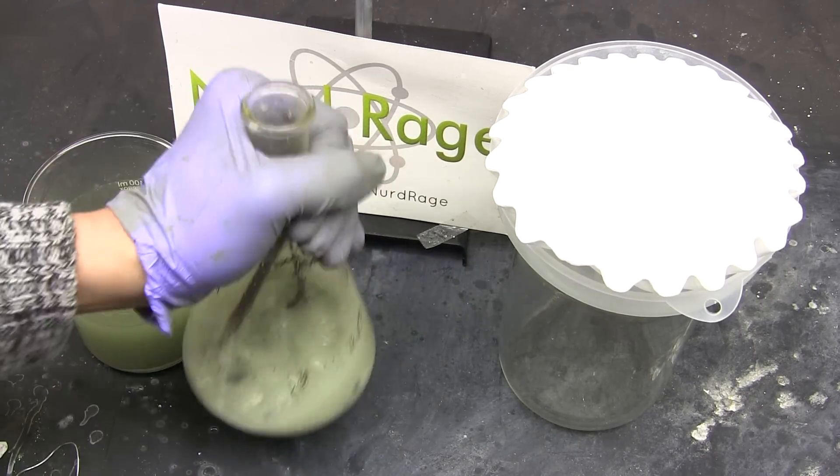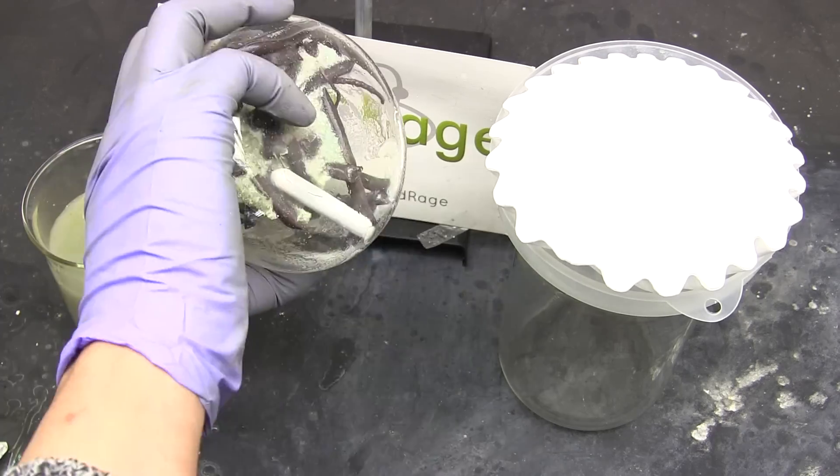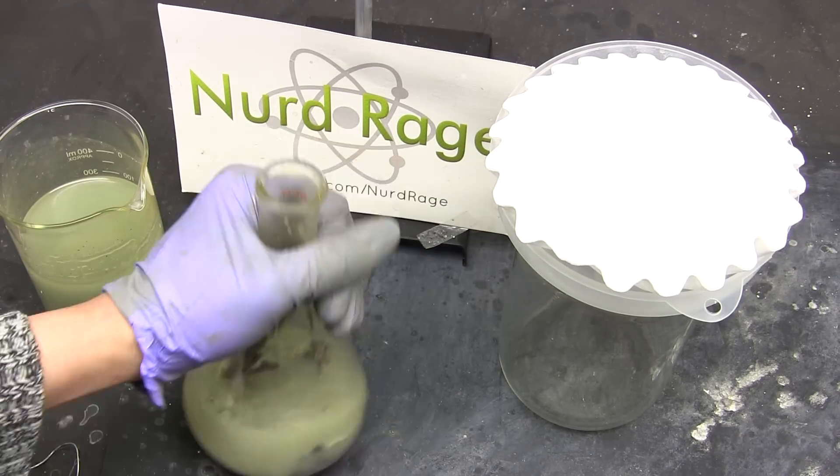At the same time try and remove any copper metal pieces if you can. You might have to pour it out and back in several times to do so.